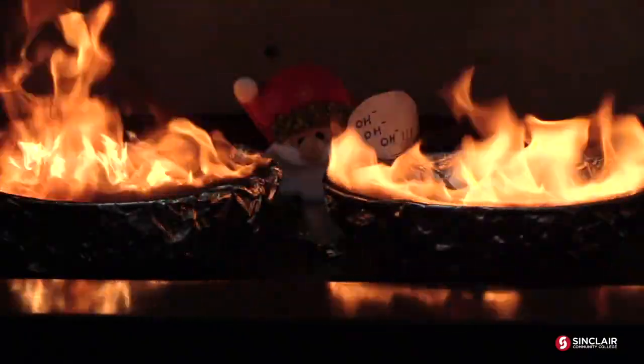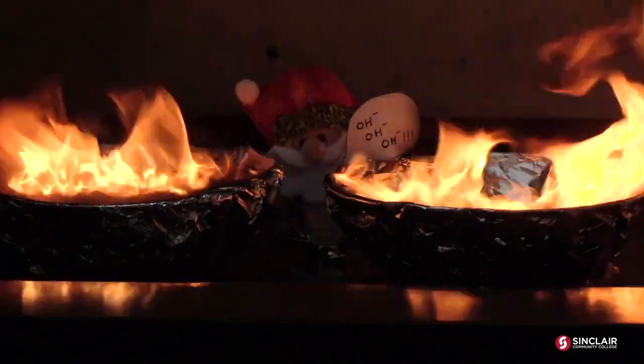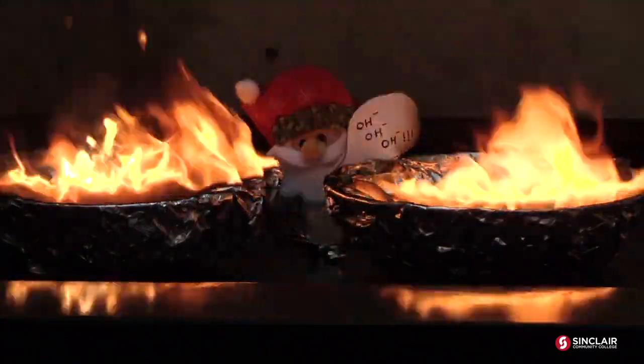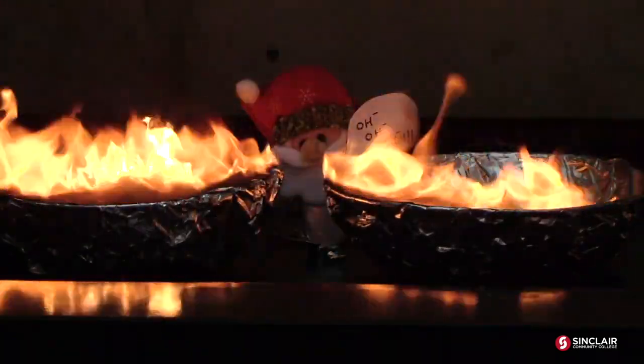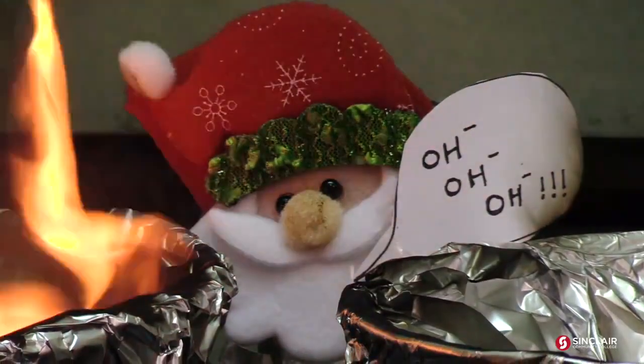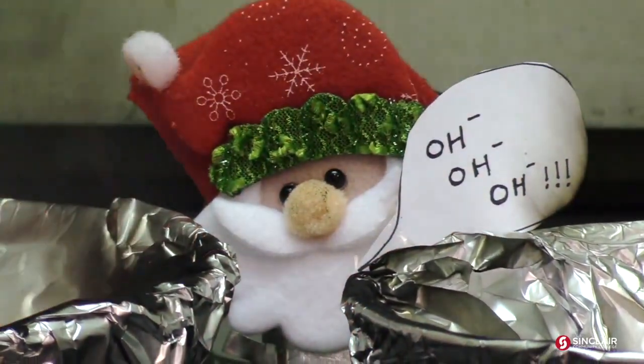Gee, where's my safety glasses? Do I get hazard pay for this at least? I don't know. Oh. Oh. Oh. Oh. Oh. My goodness.